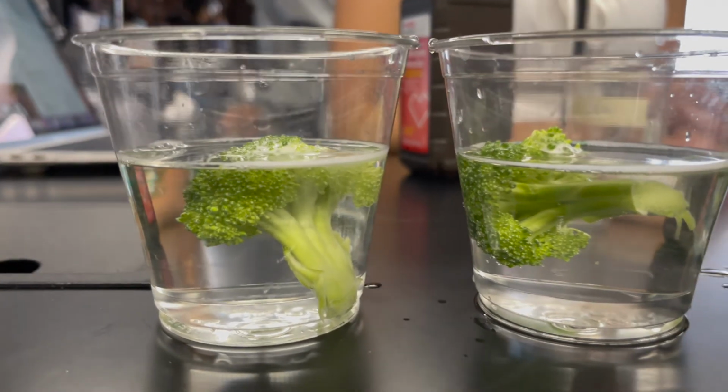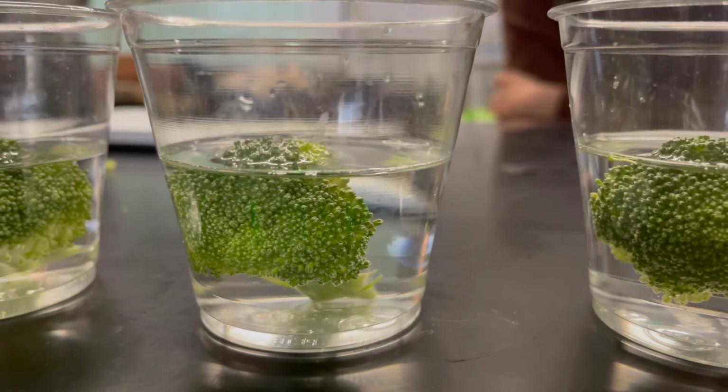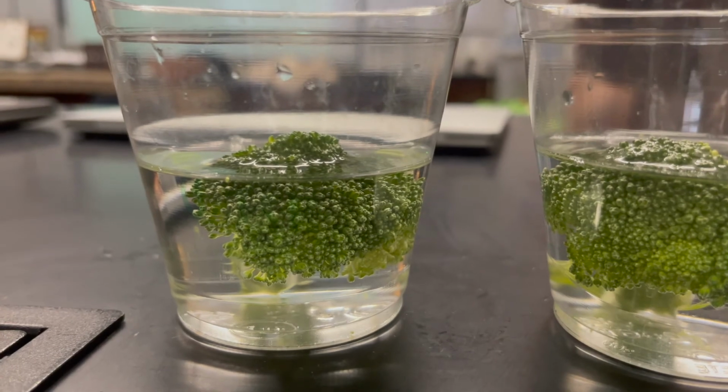For example, in trial 1 with 11.7 broccoli enzyme between cup 2 and 3 with 1 teaspoon and 2 teaspoon hydrogen peroxide concentration respectively, there was only a 0.4 height difference. This data is also validated by Scientific American, stating it should have resulted in a similar amount of foam as in cup 2, which there was because there was little to no height difference, further ensuring that the data we collected from the experiment was accurate.